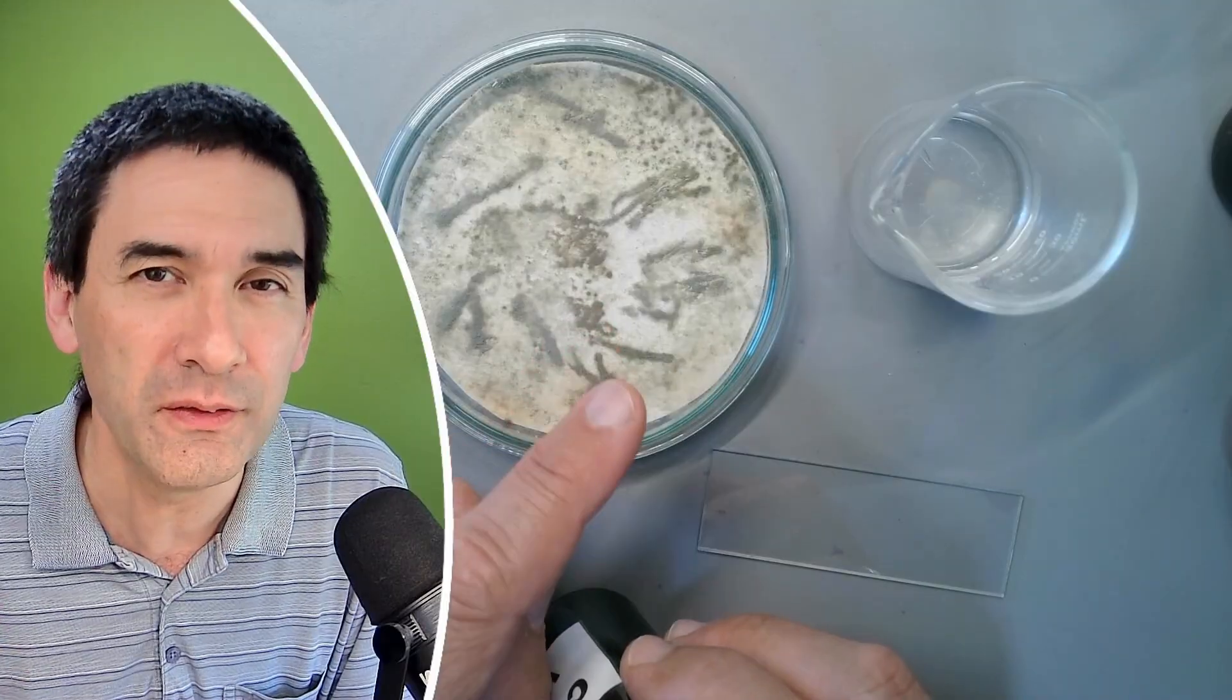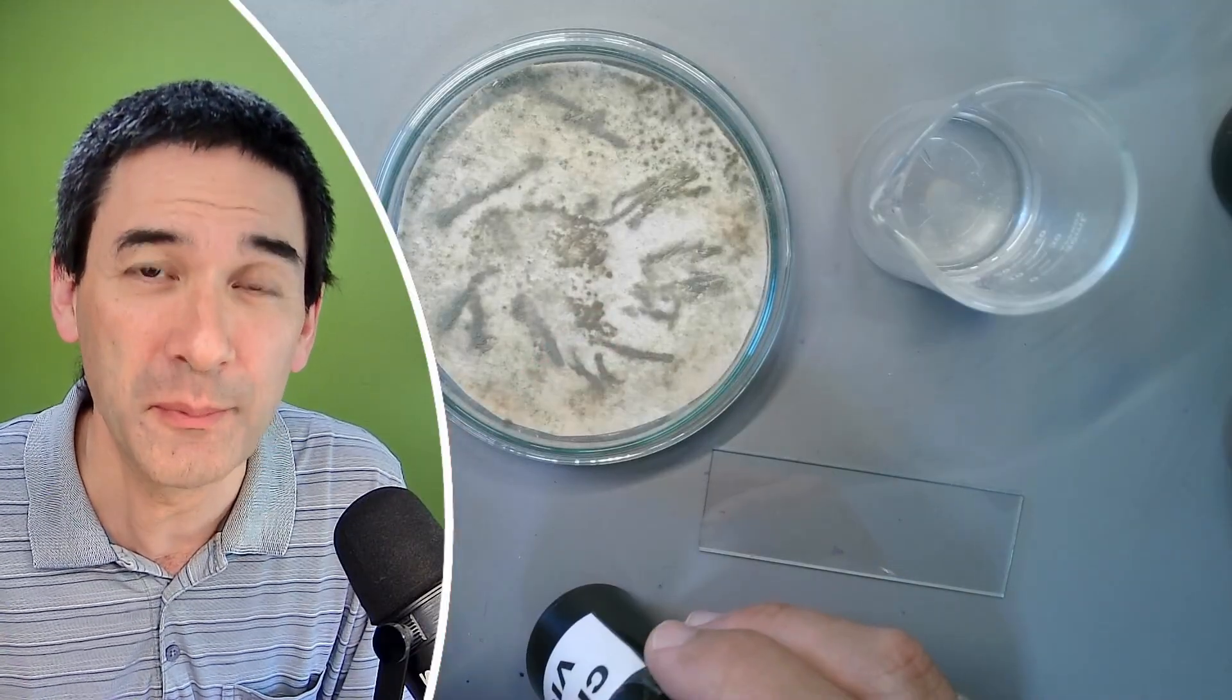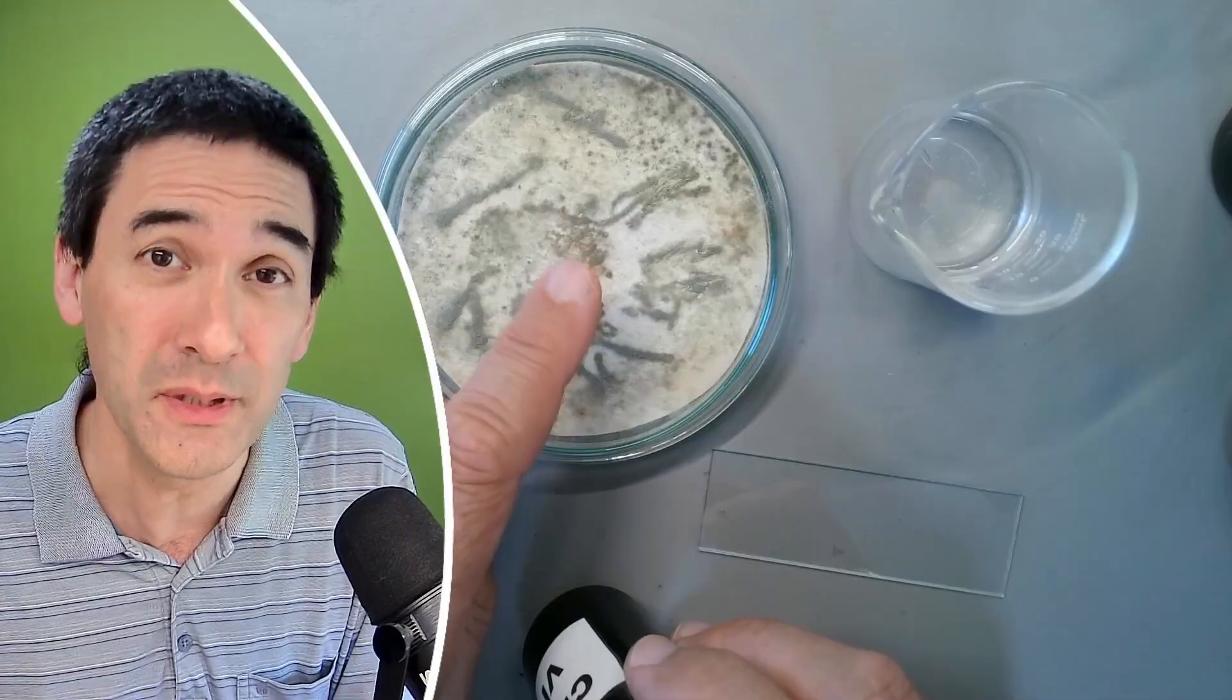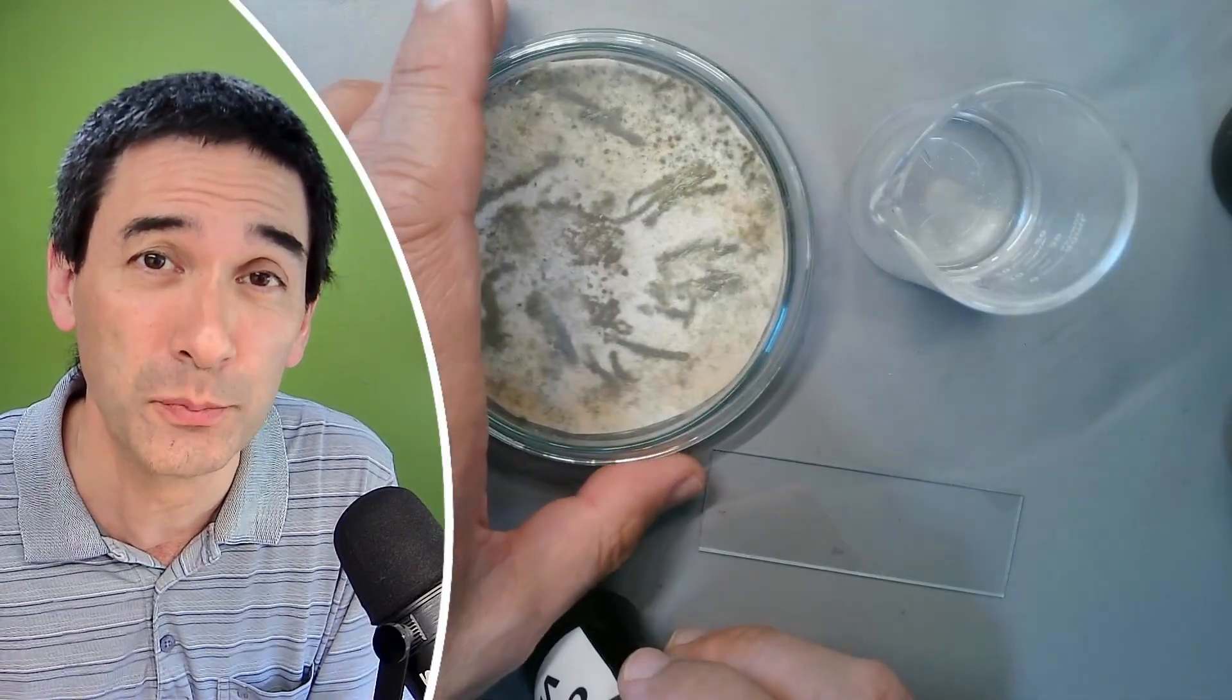Now they are not very visible when you put them under the microscope. The contrast is low. It's possible to see them, but not quite as well as you probably would hope for.